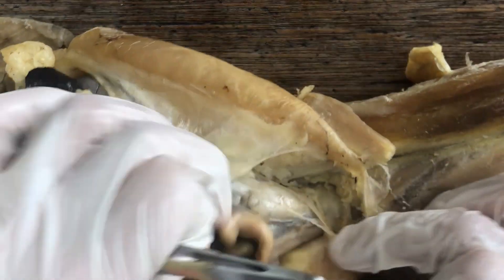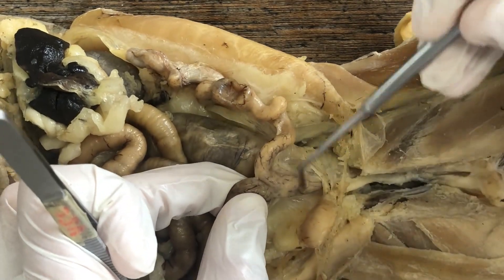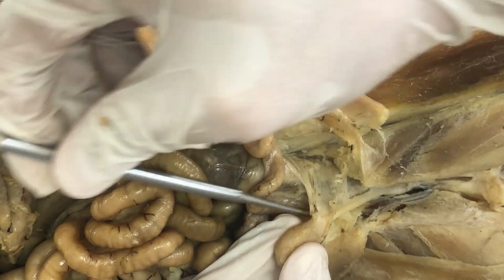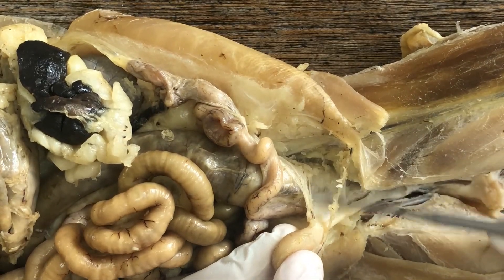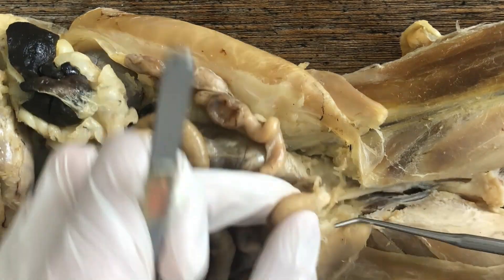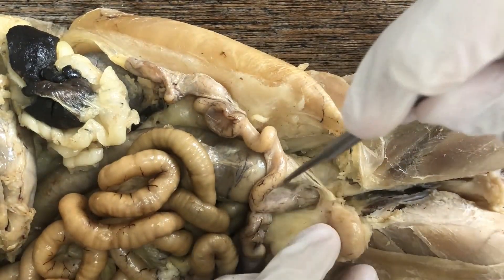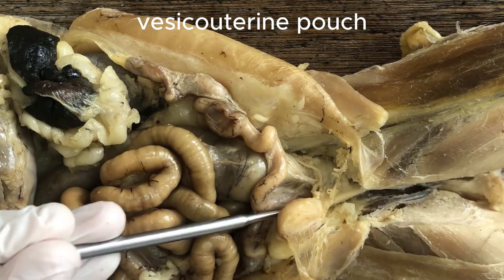Between the vagina and the urethra there is a pouch — a pocket bounded by the lateral umbilical ligaments. That pocket between the urethra and the vagina is called the vesicouterine pouch.